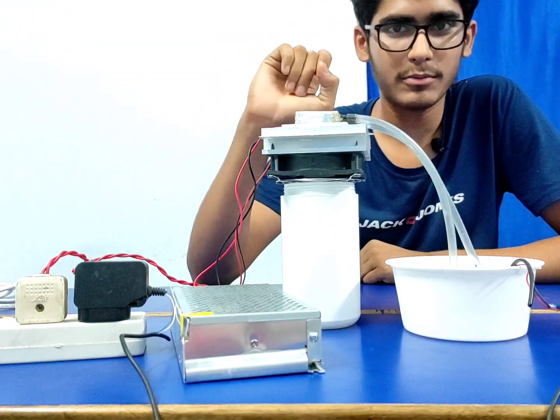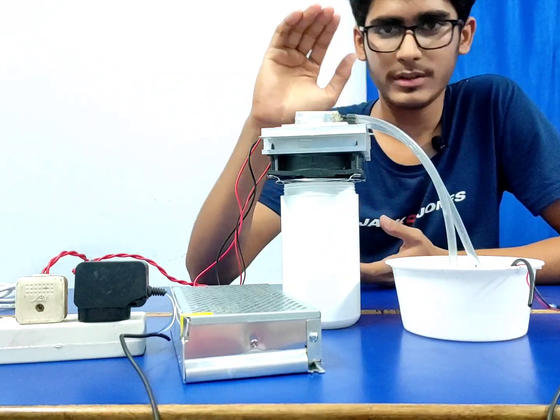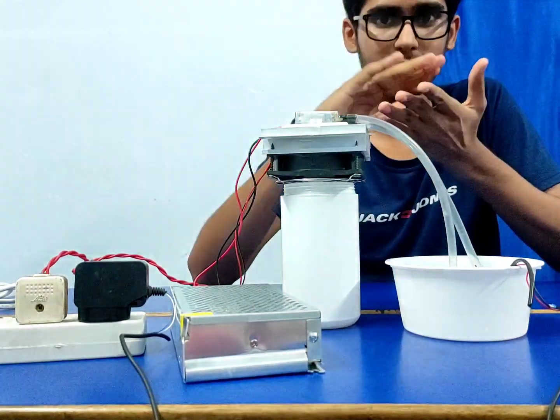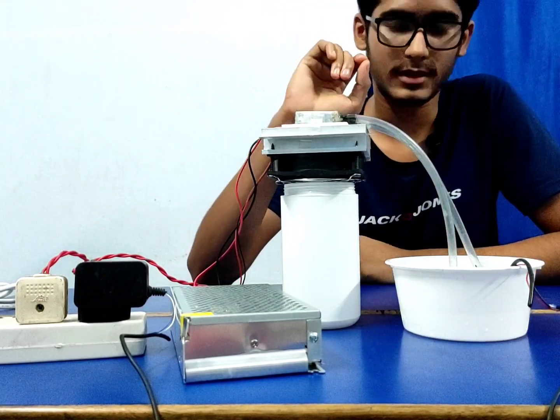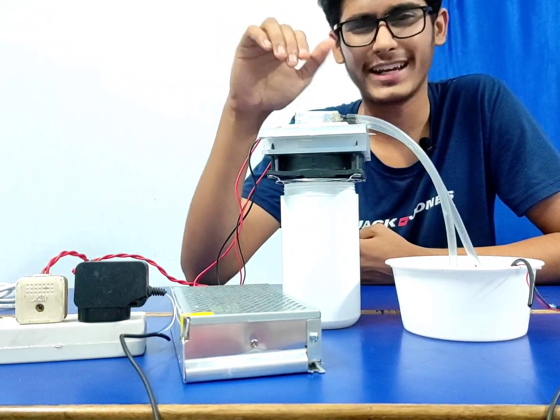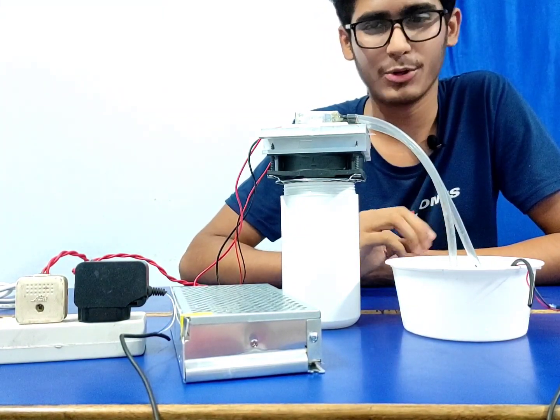The main function of the Peltier module is to create a temperature difference. It does not know if it's cooling or heating. It knows that it has to create a temperature difference between the two plates. It contains semiconductors that help in doing that. I will not get very much into it, as it will complicate the video and I don't want that.